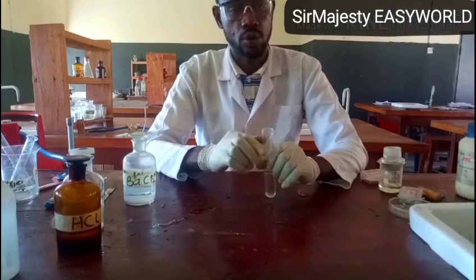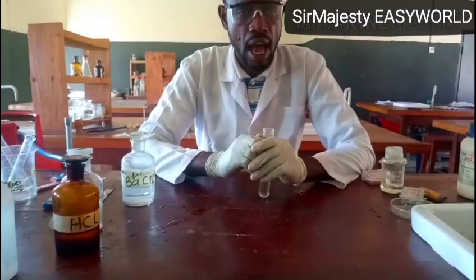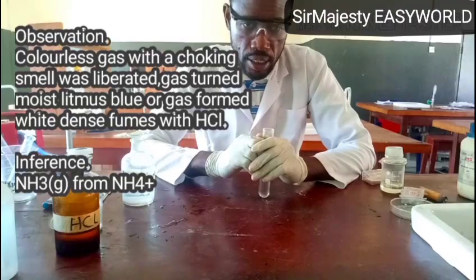Then you might also be required to add a few drops of dilute sodium hydroxide to the solid sample of C and then warm gently. On doing this, ammonia gas will still be liberated.